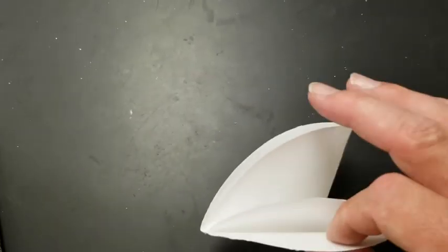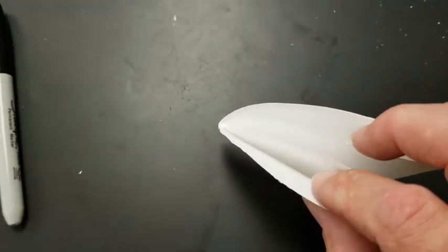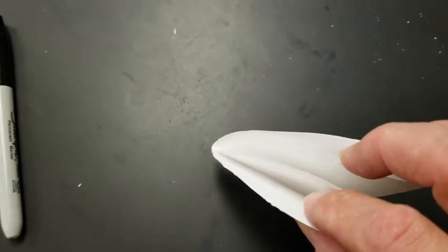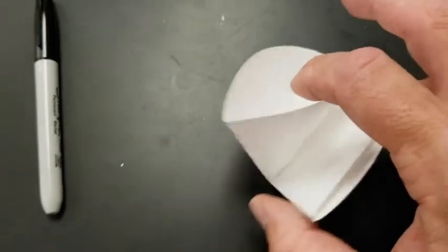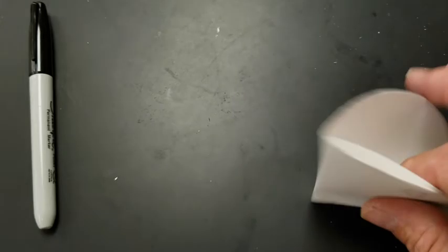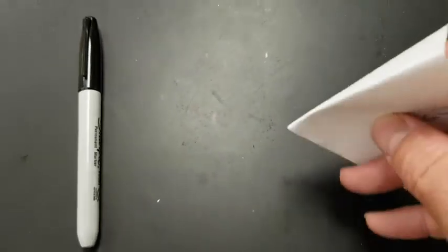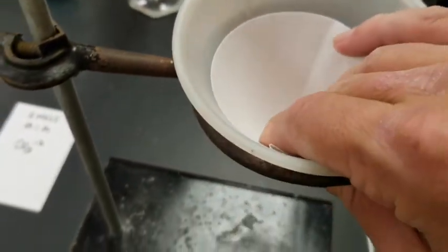All right? So now what we're going to do is we're going to take this, and you'll notice that there are now 4 layers here. 1, 2, 3, 4 different sheets of paper because I folded it and folded it again. What you're going to do is you're going to put your finger in there and make 3 in 1. It doesn't matter which side. You can go 3 in 1 this way, or if you want, you can go 3 in 1 this way. Put your finger in there like so. It really doesn't matter as long as there's 3 layers on one and 1 layer on the other. And then this whole thing goes into a funnel like so.